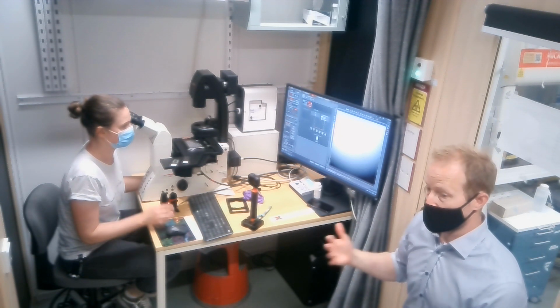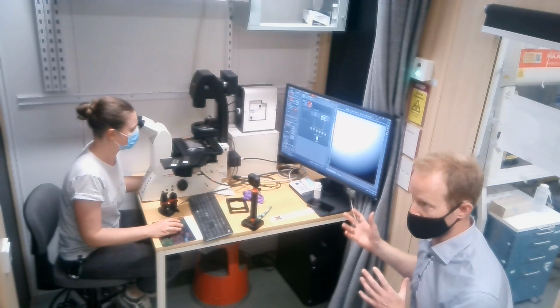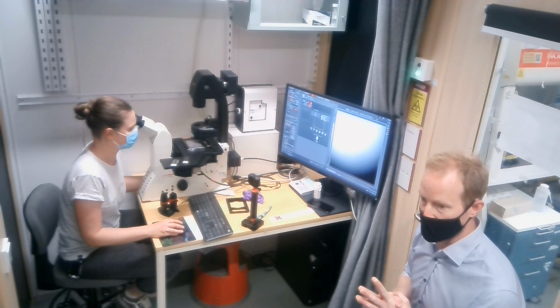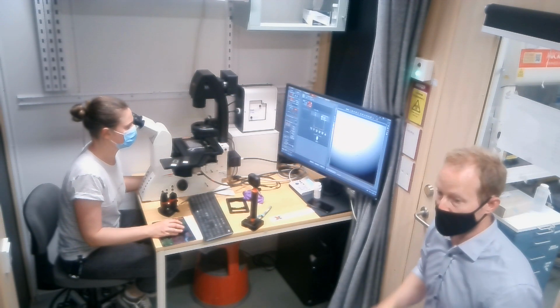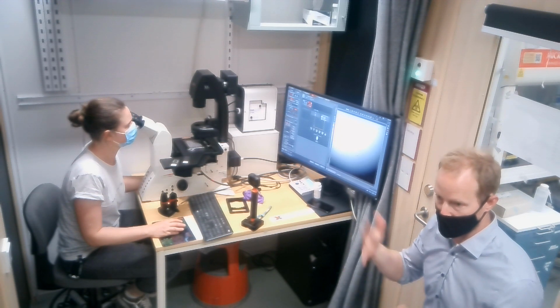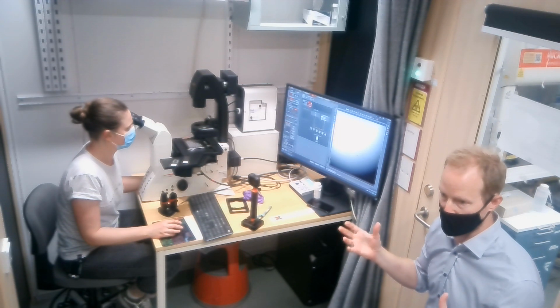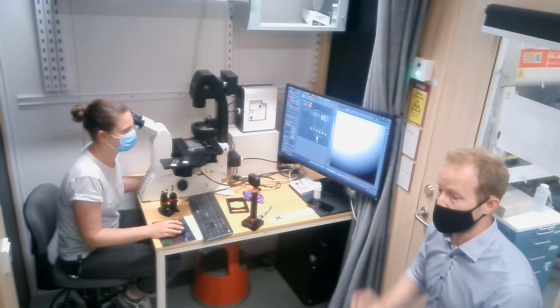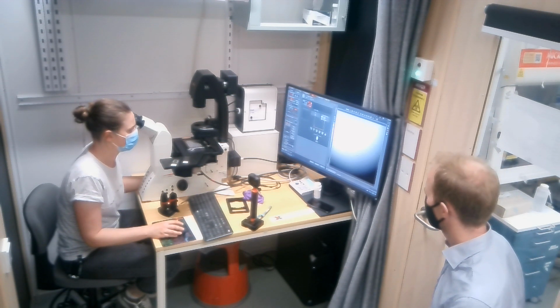You can also, as an option, when you export your files, we looked at this export TIFF before. If you want to have a scale bar, that's an option in the export process also. Typically, you don't get that if you're exporting the raw file, because you don't want to have a scale bar in the raw file. But if you're exporting a scaled image because you want to have it for a publication, presentation, or something like that, then you have that option to include the scale bar in the export.